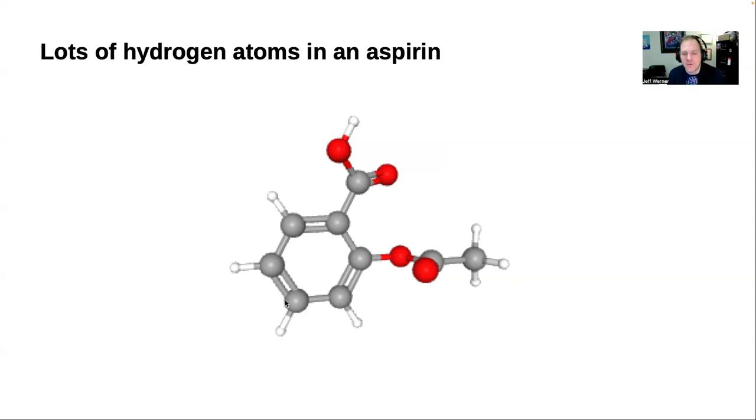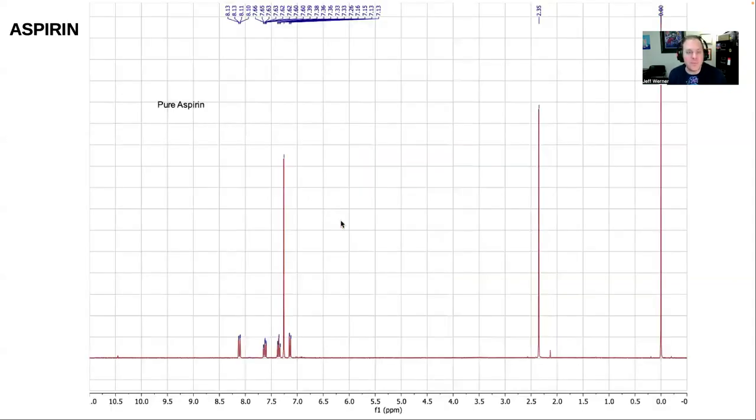Each of these hydrogens is going to give us at least one or more peaks on our NMR data. If we look at pure aspirin, a sample of pure acetylsalicylic acid, not from this lab but store-bought, we get a signal that looks like this on the NMR. What I want to draw your attention to is that the position of the peaks is what's important. You see the x-axis, and there's no y-axis information, because the y-axis is not very useful or meaningful in these data. It's the location of each peak in the left to right direction along the x-axis that matters. The field in parts per million on the x-axis tells you how shifted each of these peaks, or little clusters of peaks, is, and each peak or cluster of peaks is a hydrogen atom. This stuff over on the right is not so useful.